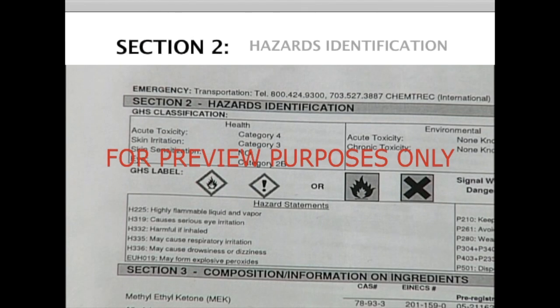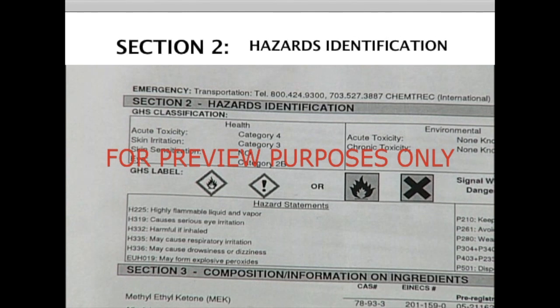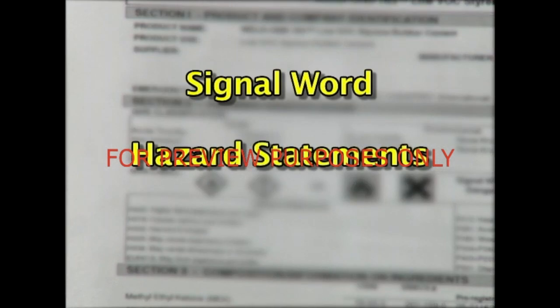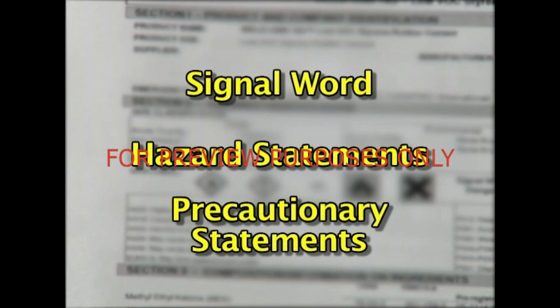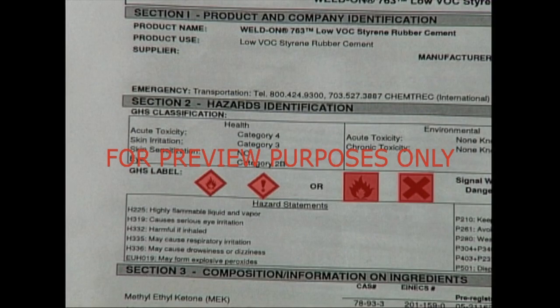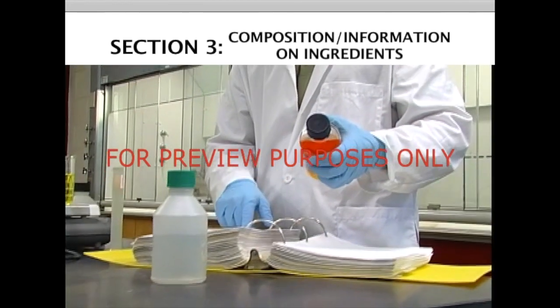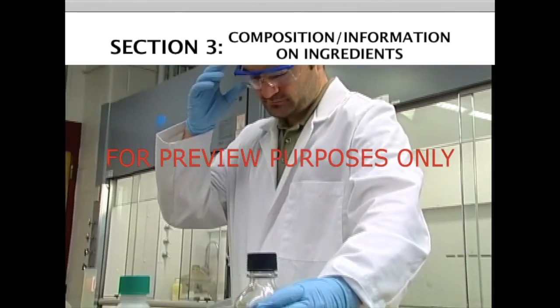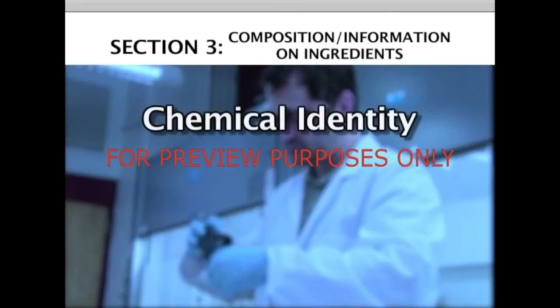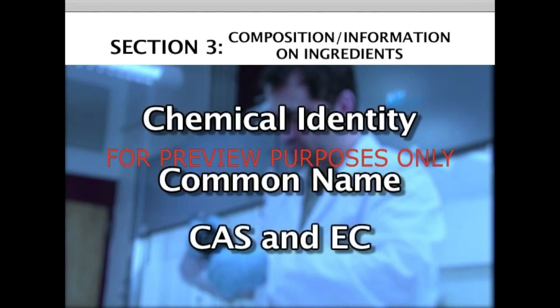Section 2 describes the hazards that are associated with the chemical, including the information that's provided on the chemical's label, such as the signal word, hazard statements, and precautionary statements. It may also contain copies of the GHS pictograms that appear on the label. Section 3 discusses the ingredients in the chemical and its composition. It also provides additional identifying information, such as its chemical identity, common name, and CAS and EC numbers.